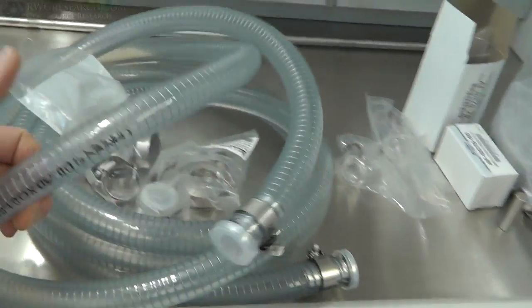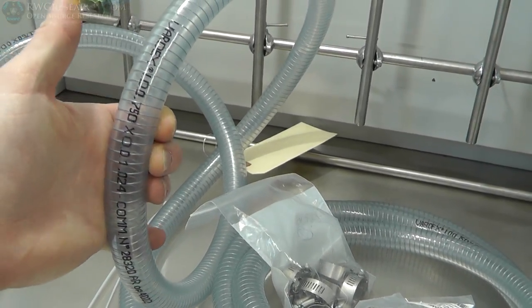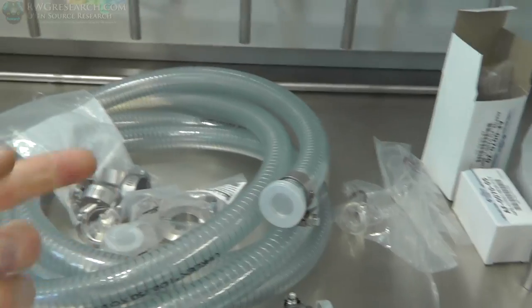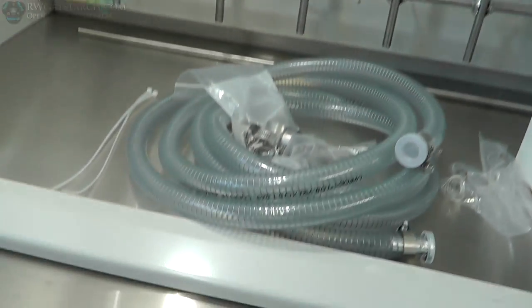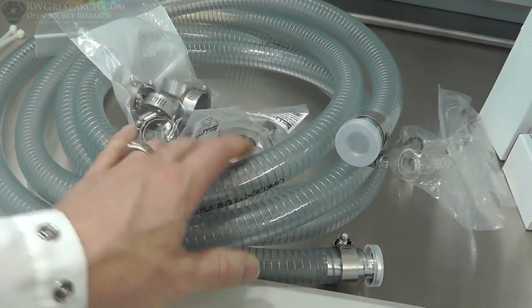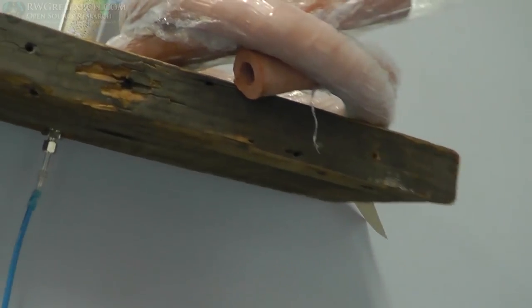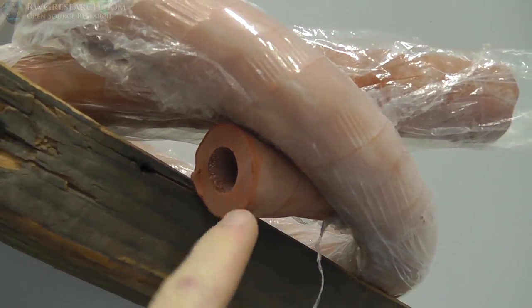Now this hose is, I think it's PVC. But it is lined with a metal spring so that it can't collapse, because this will be pulling a vacuum. So if you have a hose that's weak or not rated for vacuum, it will actually collapse, which is a problem. Now the other hose that we have for this particular project, which is what you normally see on vacuum systems like this, this is a rubber hose.